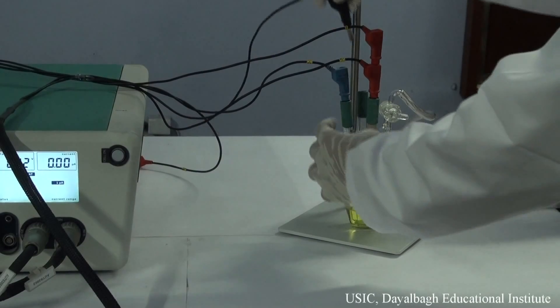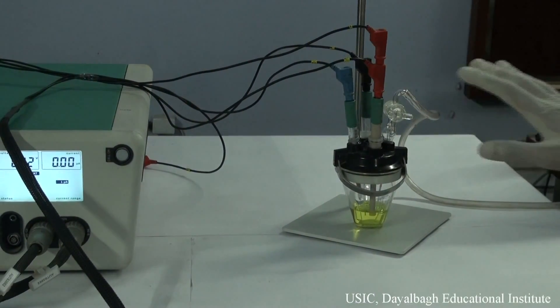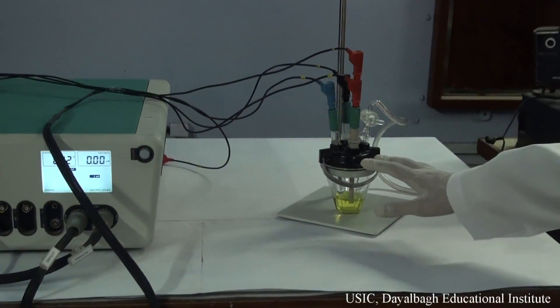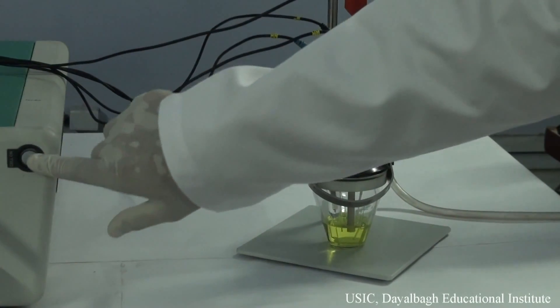Then the counter one for the platinum wire. Now our system is ready for running the experiment. We switch on this button.